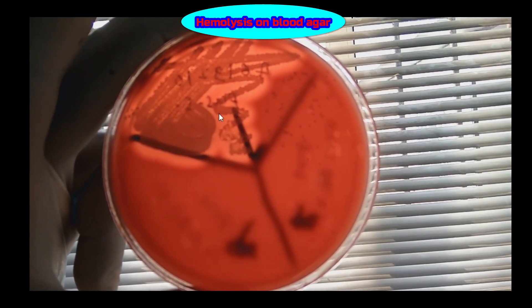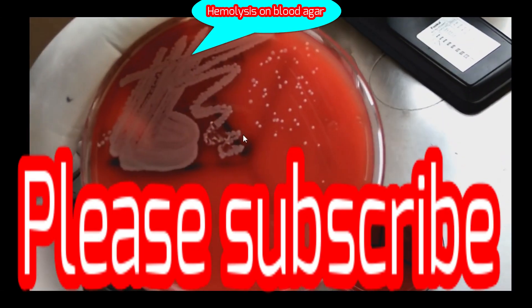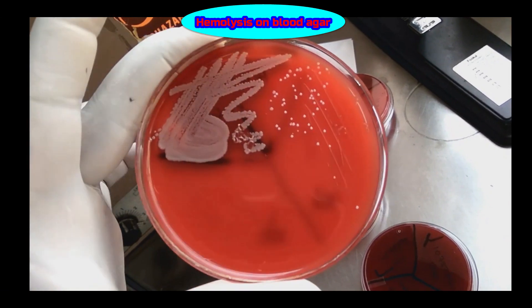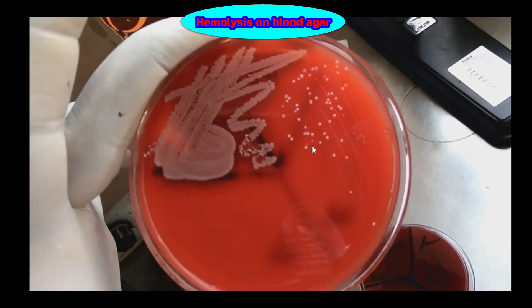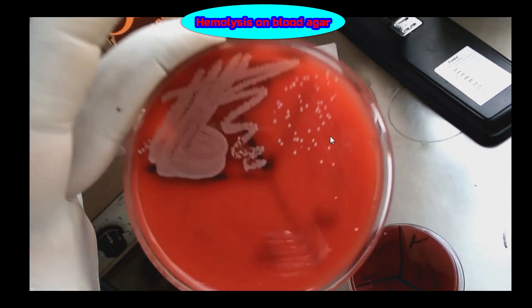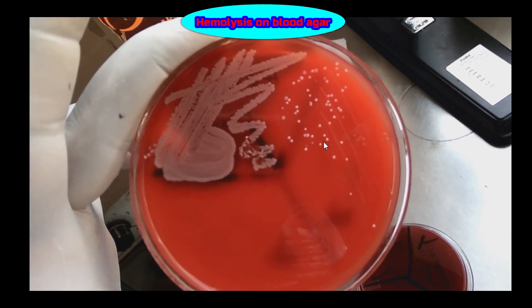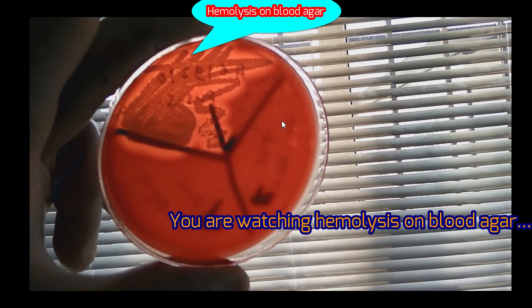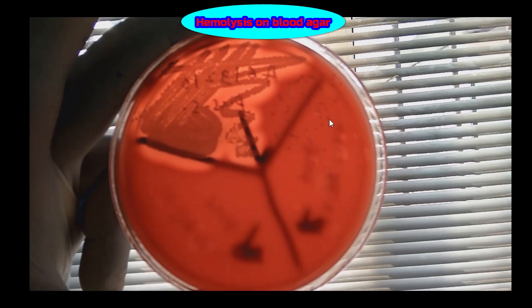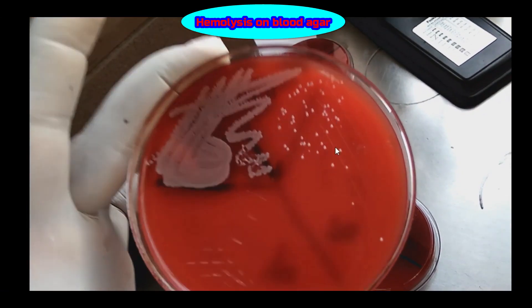Here you can see the beta hemolytic colonies. Whereas for these colonies, there is no zone of hemolysis around them, so these colonies are non-hemolytic, or gamma colonies — those colonies are lacking a zone of hemolysis around them in this region.